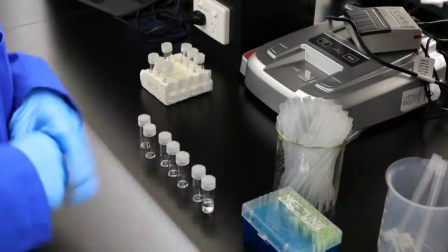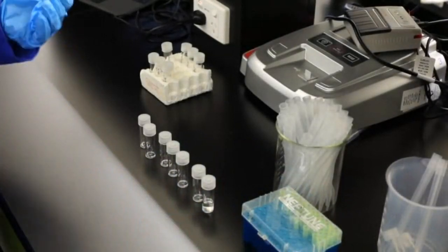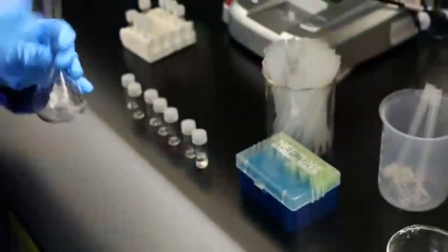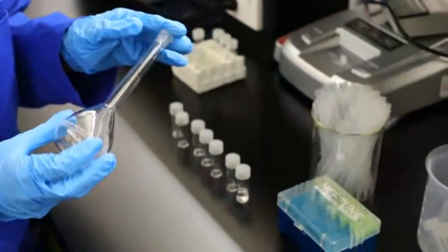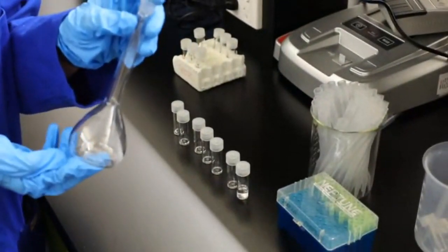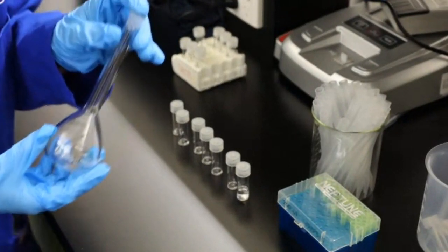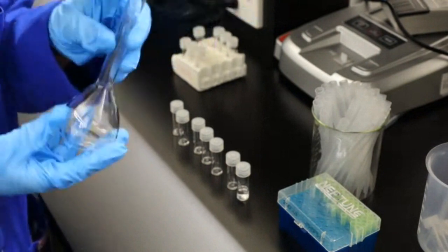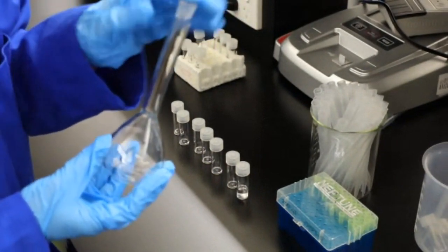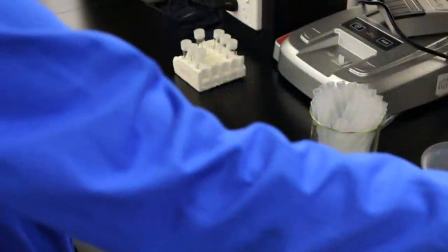All right. So normally when you are doing your stock solutions and a calibration curve and things like that, you would be using large volumes at school. So you would be using one of these. Who can tell me what this is? Yay, well done. So it is a volumetric flask.